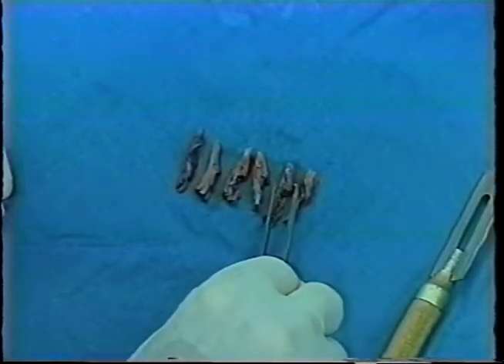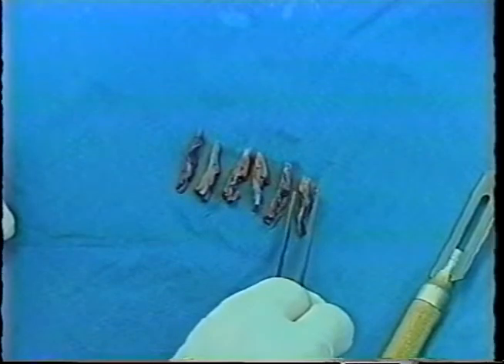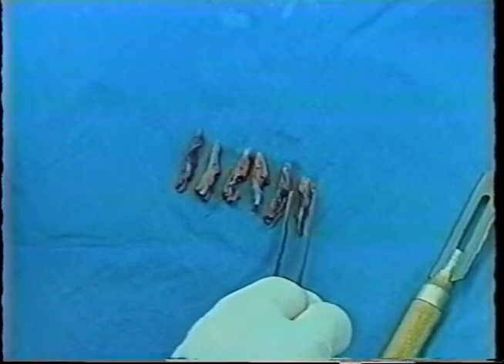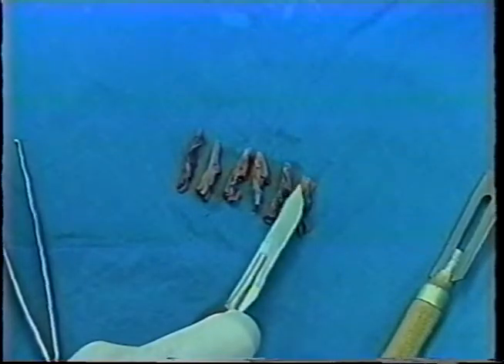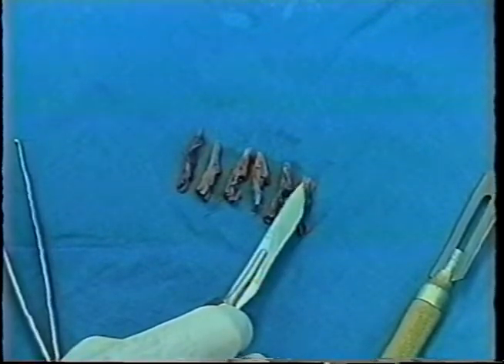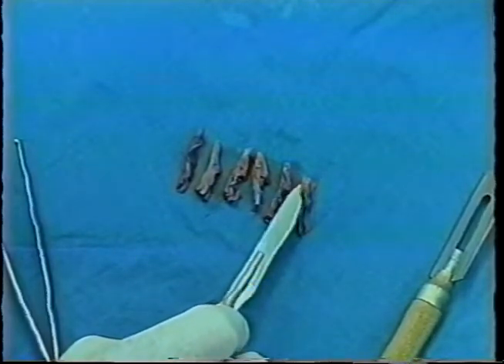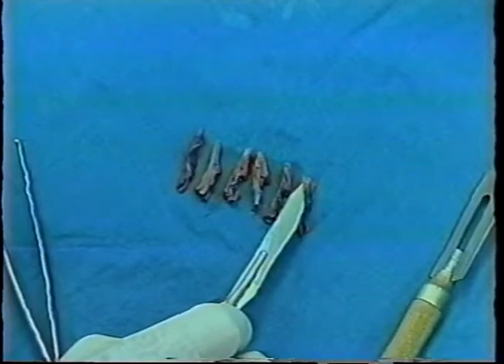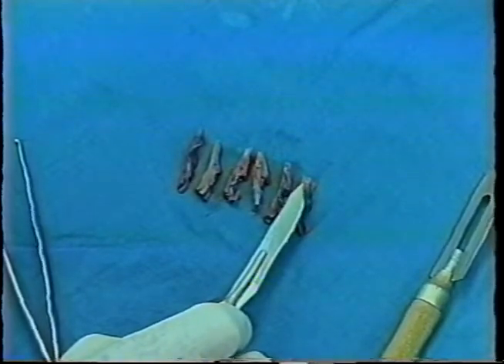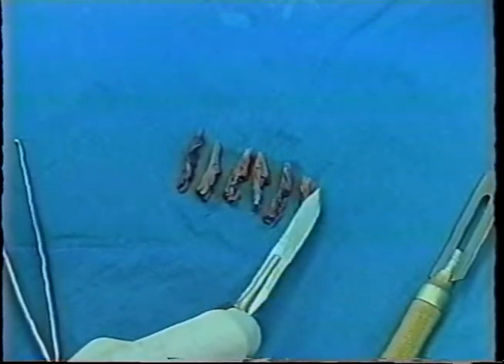The architecture of the SA node is such that the nodal tissue is grouped around the artery. If you see the artery, then you know that you have got the node containing tissue. In this case, we have 2 small arteries, and sometimes the SA node artery will bifurcate into 2 branches. There are 2 arteries at about the junction of the atrium and superior vena cava that indicate that we are in the region of the SA node. We know that this section, probably the next 1 or 2, and perhaps the 1 or 2 prior to it, will contain nodal tissue.